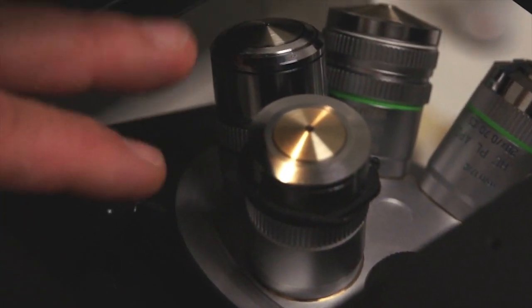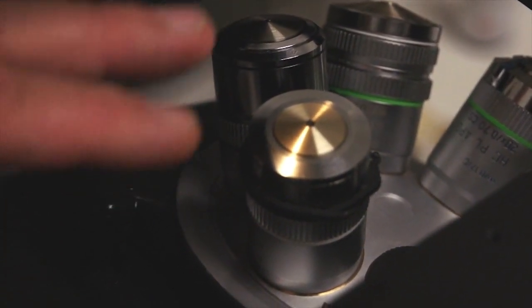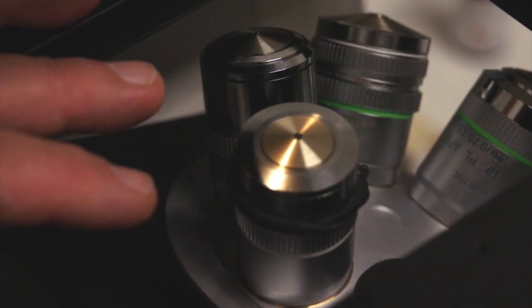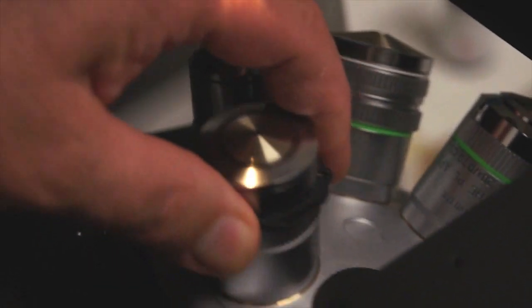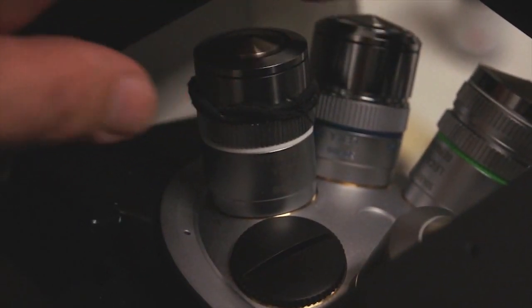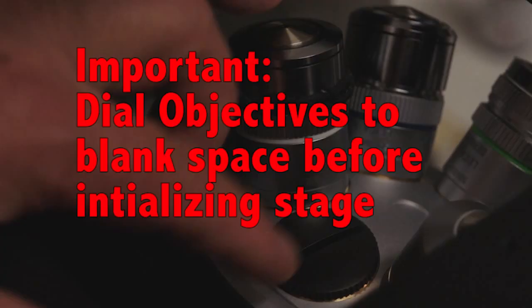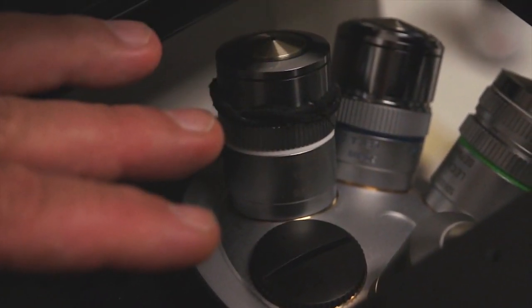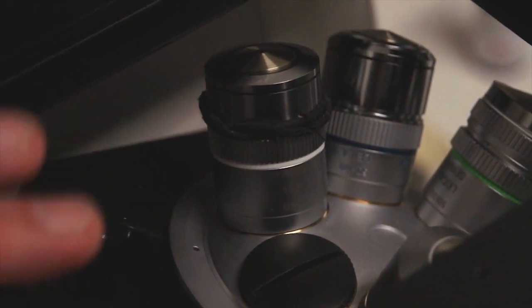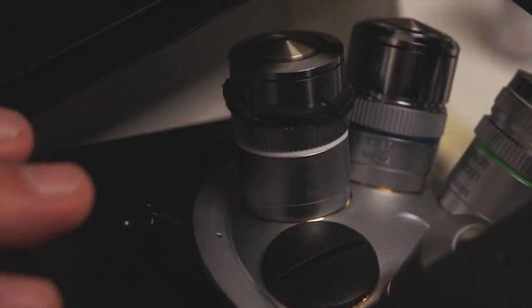It is very important to keep in mind that before you initialize the mechanical stage, you dial the objectives out of the path. It's usually best to dial it to this blank spot. That way all the objectives are below the stage and protected when you initialize the stage and the motorized function takes over.